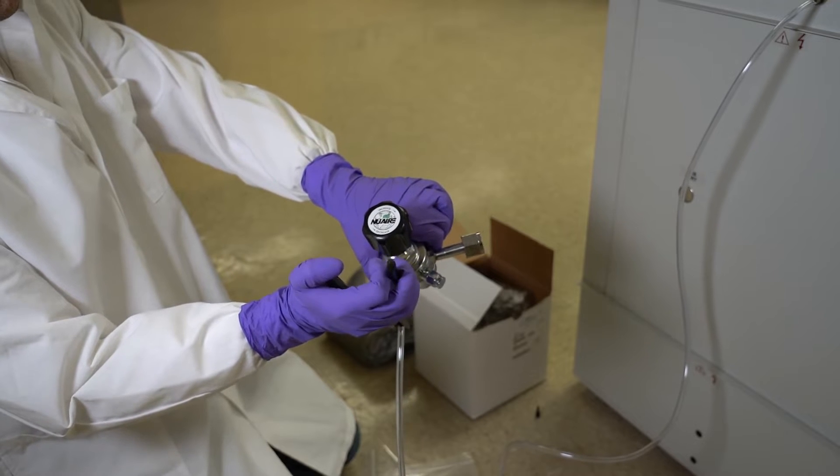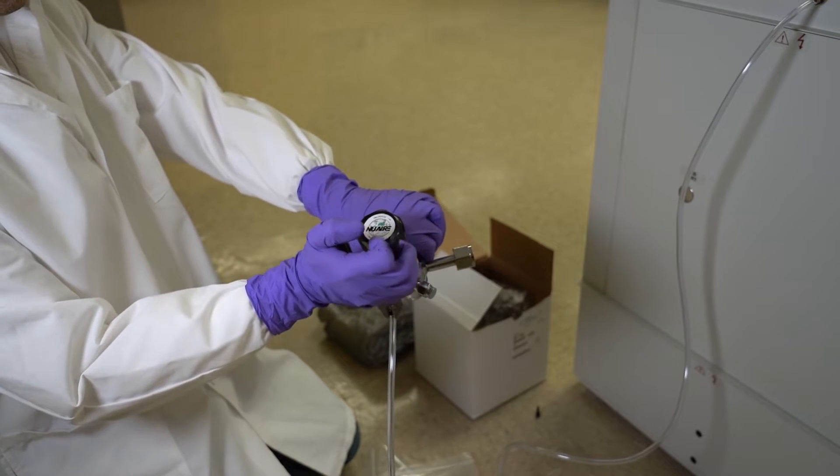Connect the other end of this tube to the low pressure side of the CO2 regulator using a black clamp.